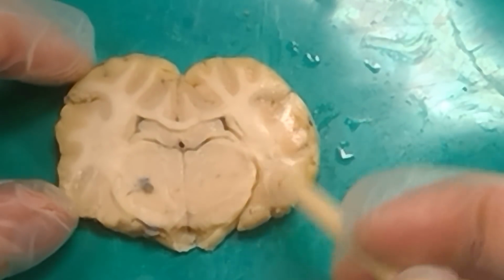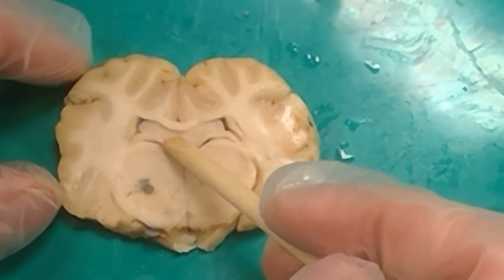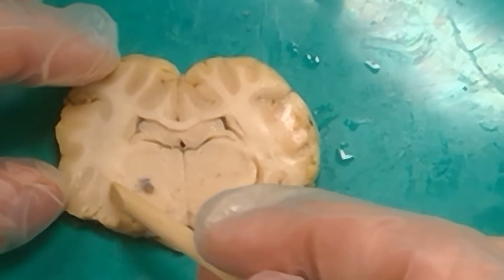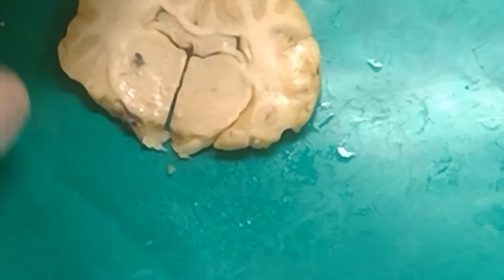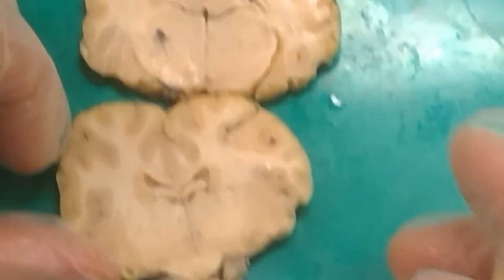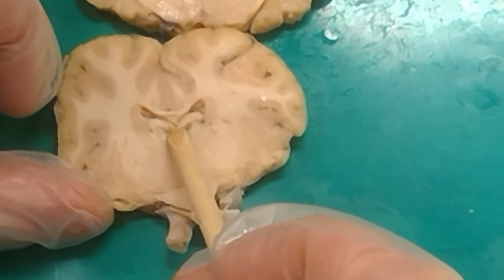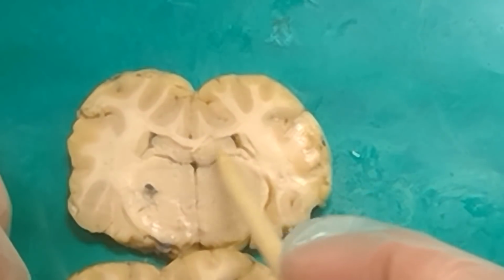So now with this guy, we can see this definitely is no longer the fornix up here. What would this be? Hippocampus. And then this part down here? Also hippocampus. All right. So how do you know when you're no longer seeing the fornix? Fornix looks like this, where it's white fibers. When we get to the hippocampus, now we've got gray matter up here.